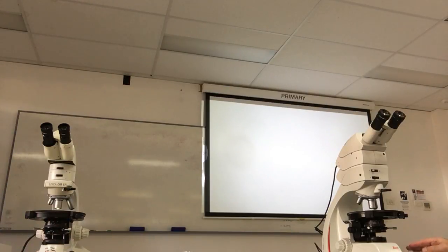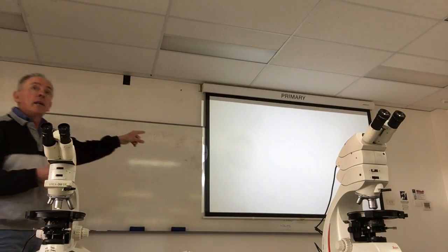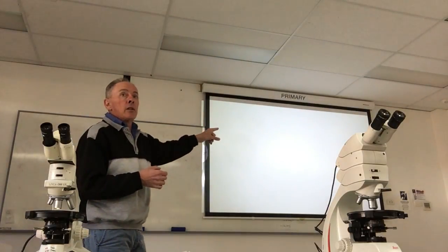On that. You will meet some new minerals in terms of things like accessories, and that's fine. Make sure you record those. Really what we do for the rest of the course is to look at textures of the rock. It's the relationship between the minerals, like that orthopyroxene overgrowing the olivine in the slide that we just looked at.